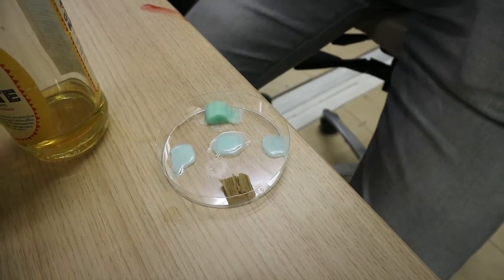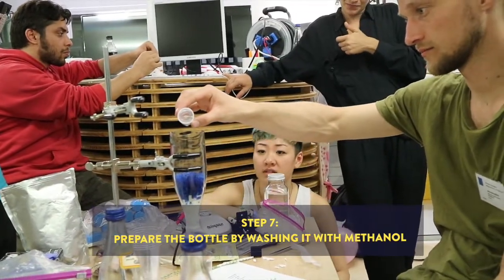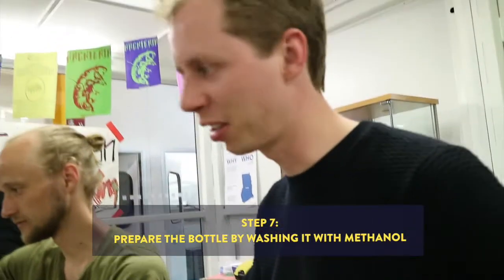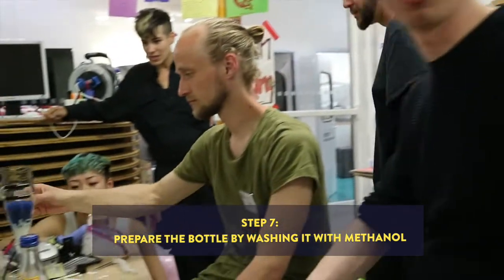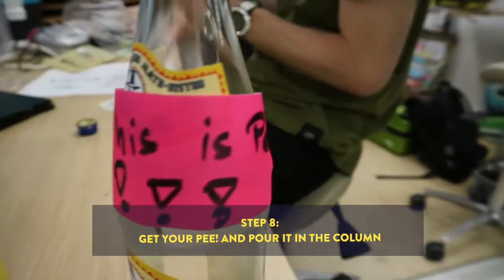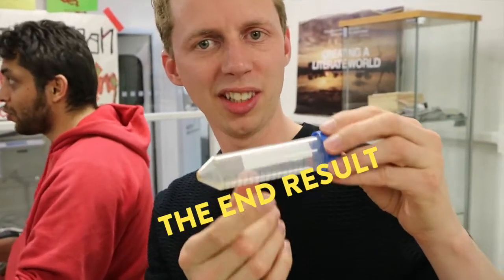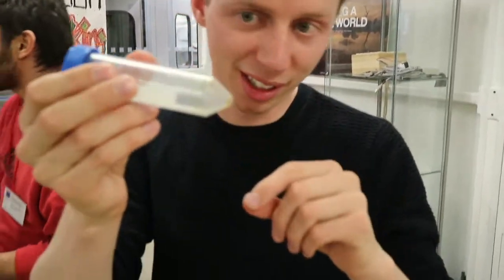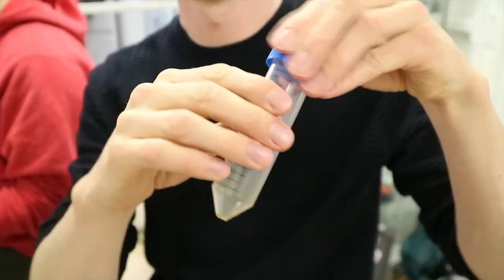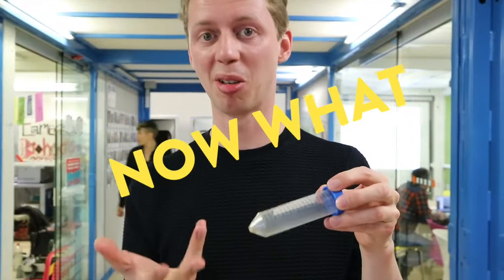Once we tested, the acetone should dissolve — try to get all around. What are we doing now, Peter? Preparing the bottle by washing it. With methanol. This is the end result. So after the urine came off the column, it evaporated the methanol, and this is what's left. These are the hormones. You can actually smell them — if only YouTube would be the smell tube. This is so awesome.